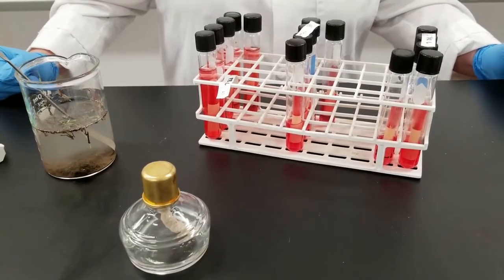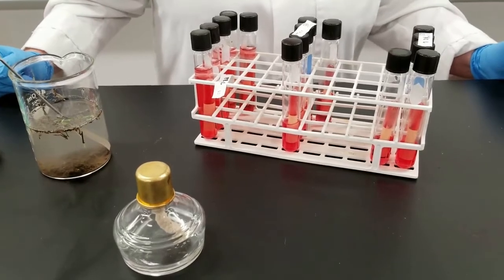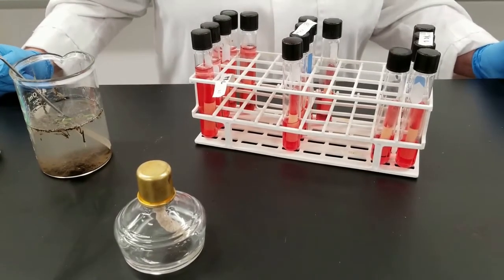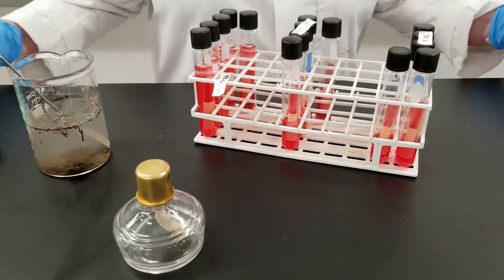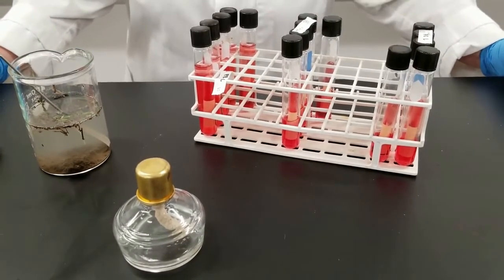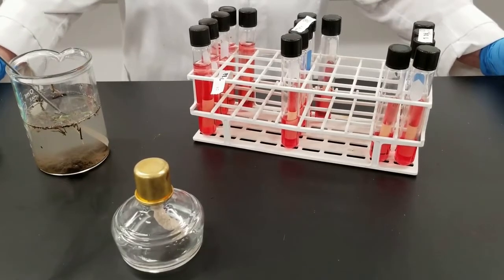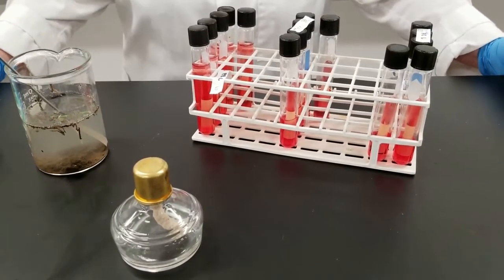There's an experiment that we do with water, looking at the microbiology of water, trying to test to see essentially what's in the water. This can often be done to determine, is water safe to drink? Is it safe for recreational activities? Or maybe it can be used, say, for watering golf courses, but not for human consumption.